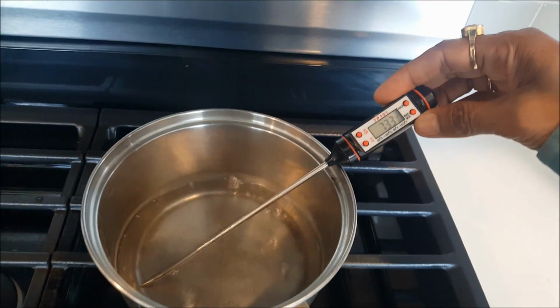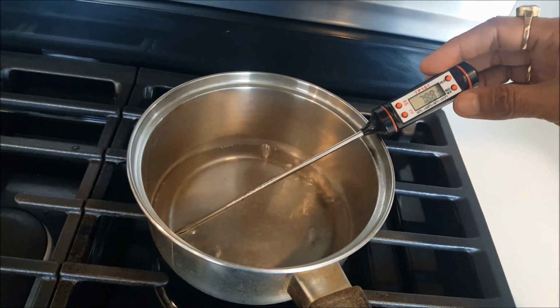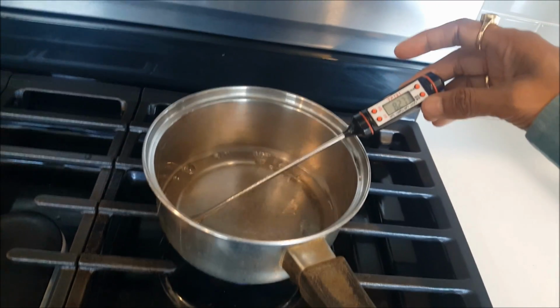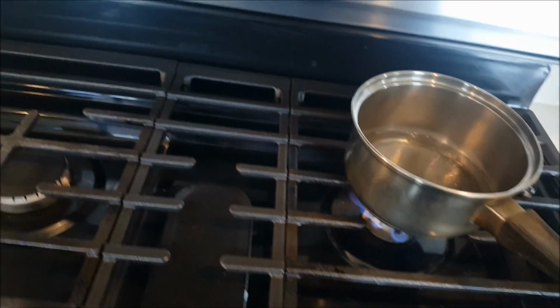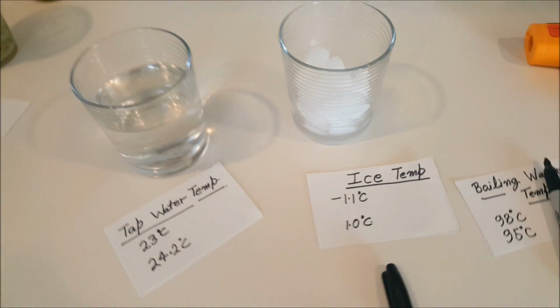So this thermometer is moving slow, therefore I'm going to use my laser thermometer, but probably this can give us the temperature of the water bath. Okay, so now oops, let's close this heating and then we'll start the experiment.